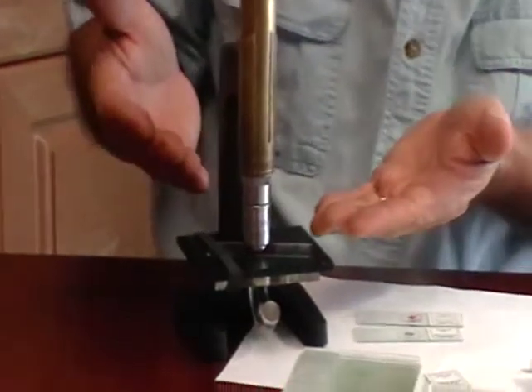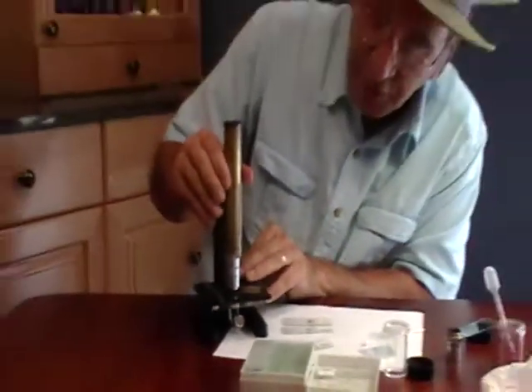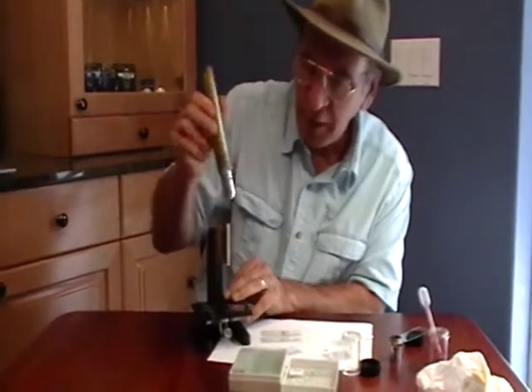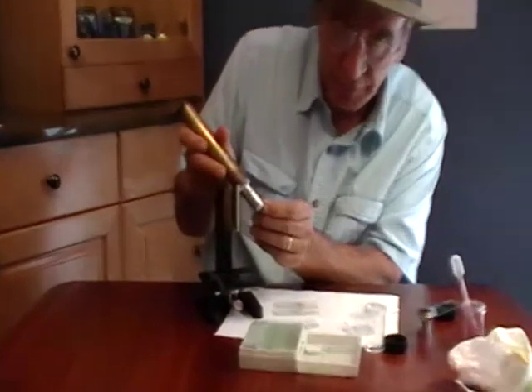We even give you two of them because they're basically broccoli bands, but they work. This will work for you if you are already in focus, or if you remember to start as low as you can and then very gradually bring it up. You'll go right through it — bring it down again. Keep in mind that all 40x objectives have spring-loaded front mounts, to help prevent damage to the glass.